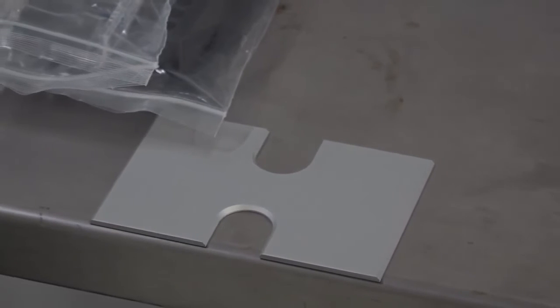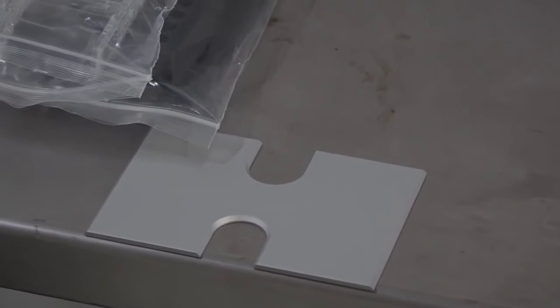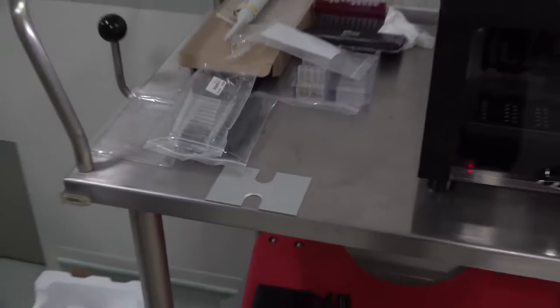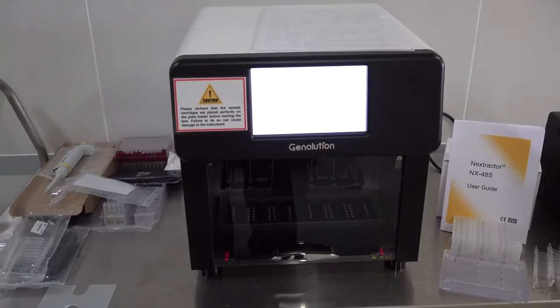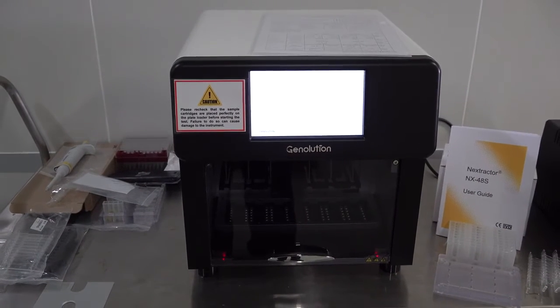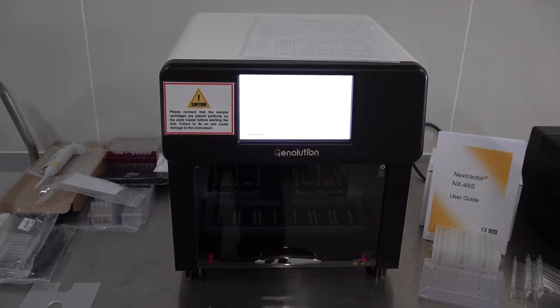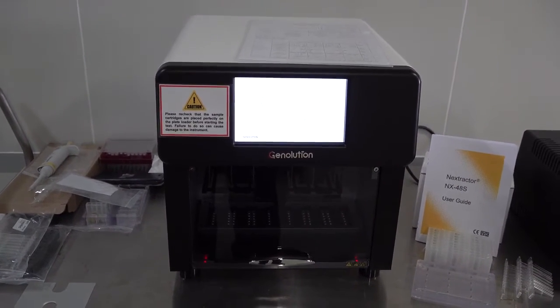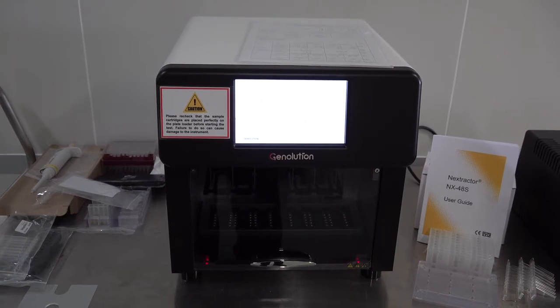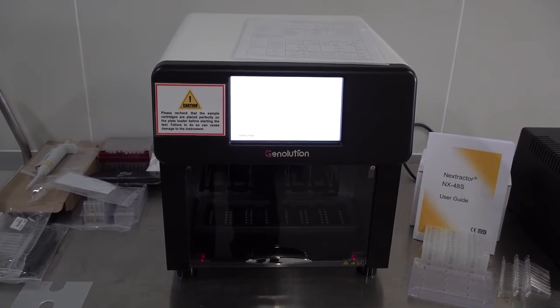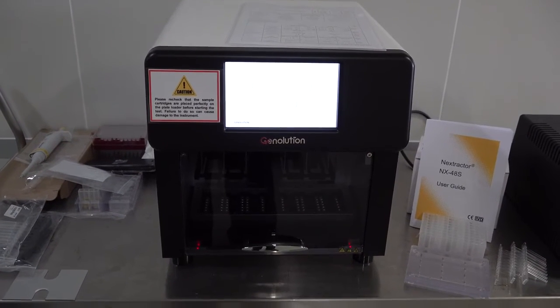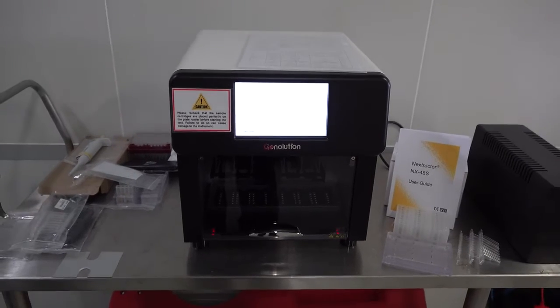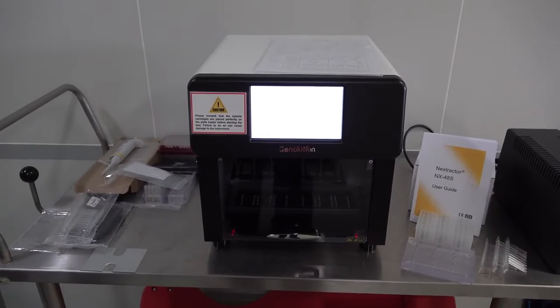The user does not have to perform the calibration as this will be performed by the company personnel. Coming back down to the machine itself, we have to carry out these extraction procedures within the safety of a biological safety cabinet as the volatile components and the aerosolized particles need to be trapped in the chamber itself. I will now proceed to the extraction procedure.